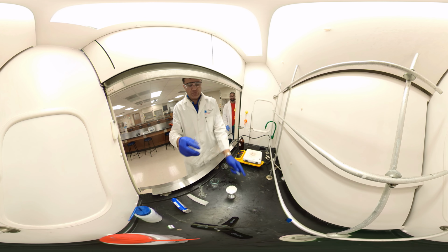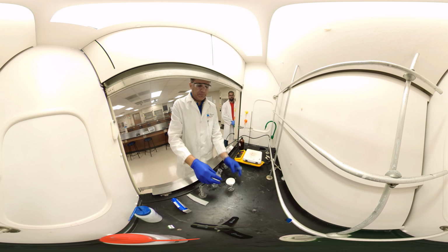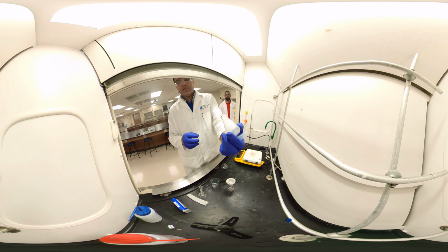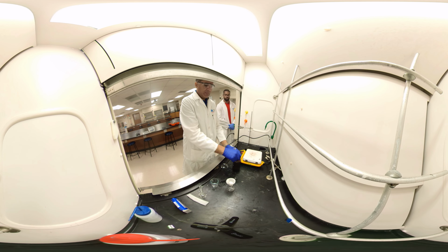Okay, I'm going to filter. So this is gravity filtration, just pour it there. The liquid should have 2 components. But you see, there is some solid. I need to transfer everything, so I'm using some dichloromethane to transfer that to the filter. That's the way to transfer everything.